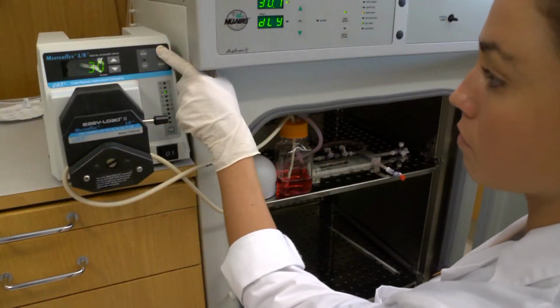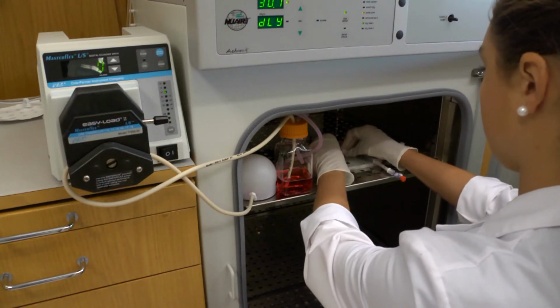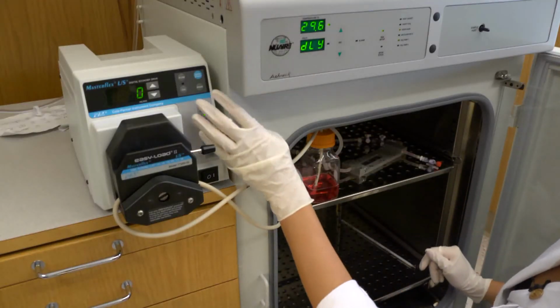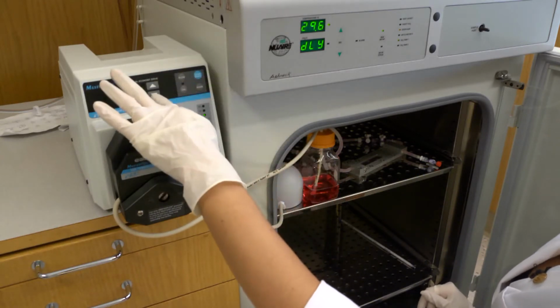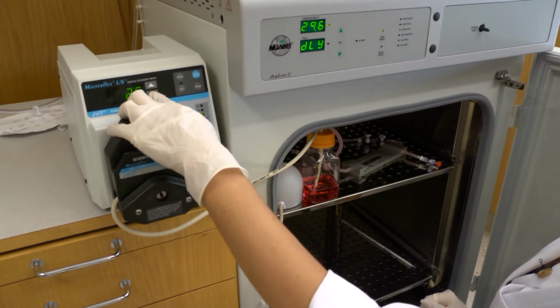Pause the flow circuit pump. Close off the flow circuit stopcocks in the direction of flow to prevent leakage. Connect the flow chamber to the flow circuit. After the flow chamber has been connected to the flow circuit, open the stopcocks in the direction of flow. Resume the flow pump and ensure that the perfusate flows in the correct direction.